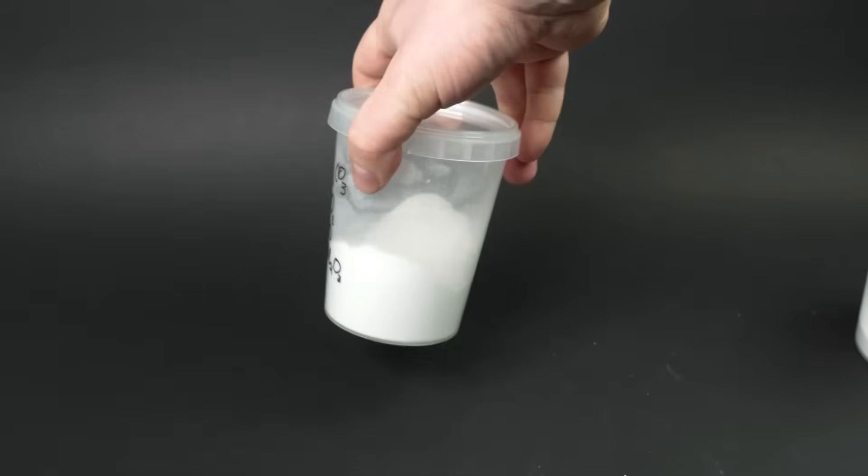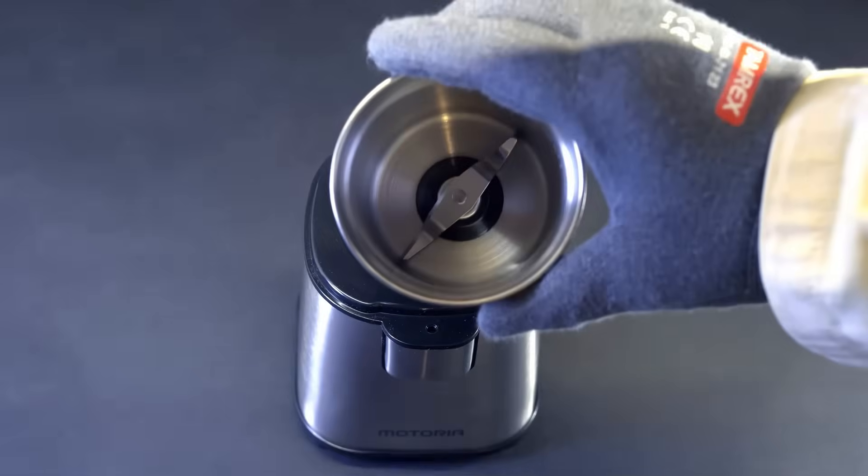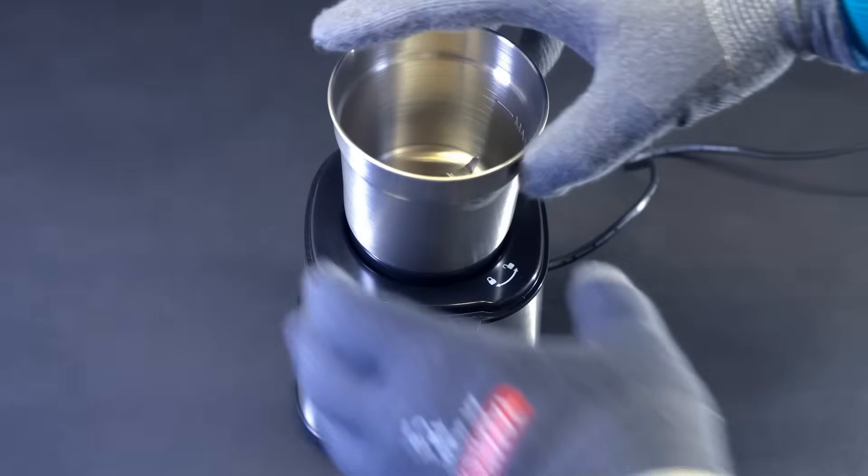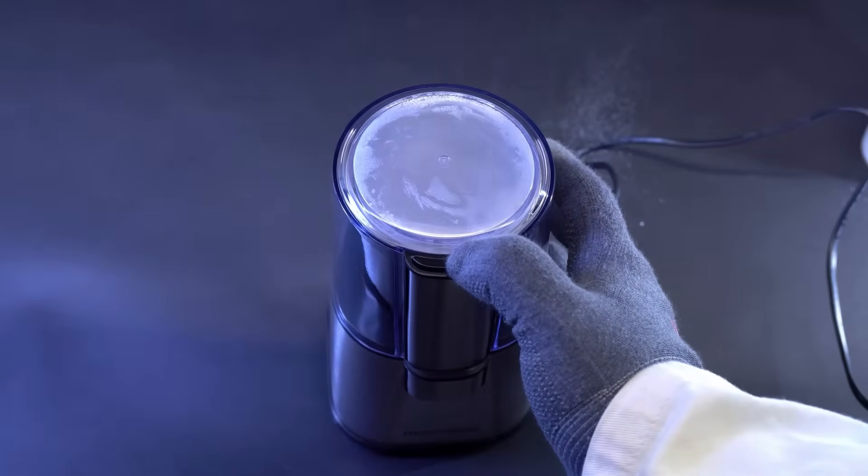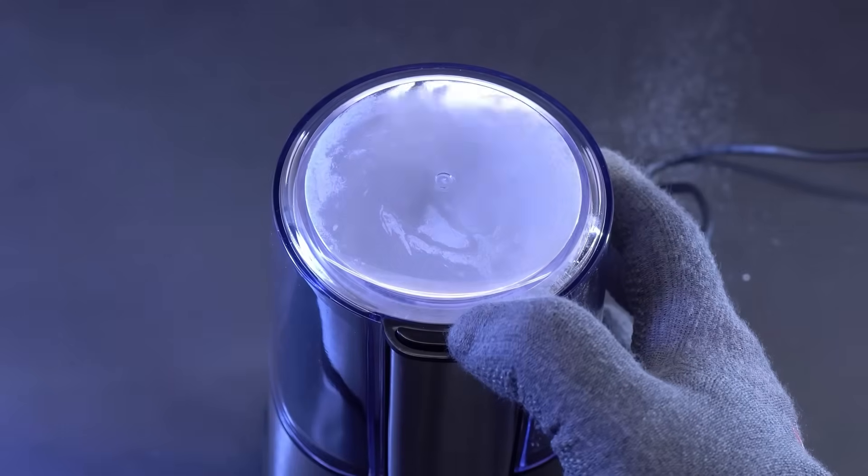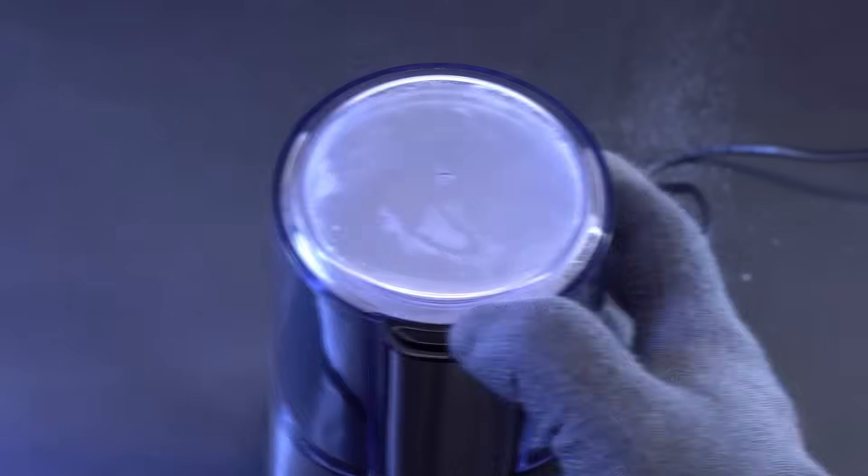In addition to soda, you'll also need quartz sand, which is almost pure silicon dioxide. But instead of that, I simply used high purity silicon dioxide, since nowadays it's actually easier to buy than quartz sand. In addition to that, I'll also definitely need calcium oxide or quicklime, which is also known as burnt lime, as well as aluminum oxide. After I've carefully weighed out all the individual components, they then need to be thoroughly and completely mixed together. For making truly high quality glass, simply mixing them in a basic plastic container probably won't be nearly enough. Each component of the glass needs to be mixed as thoroughly as possible with all the others.